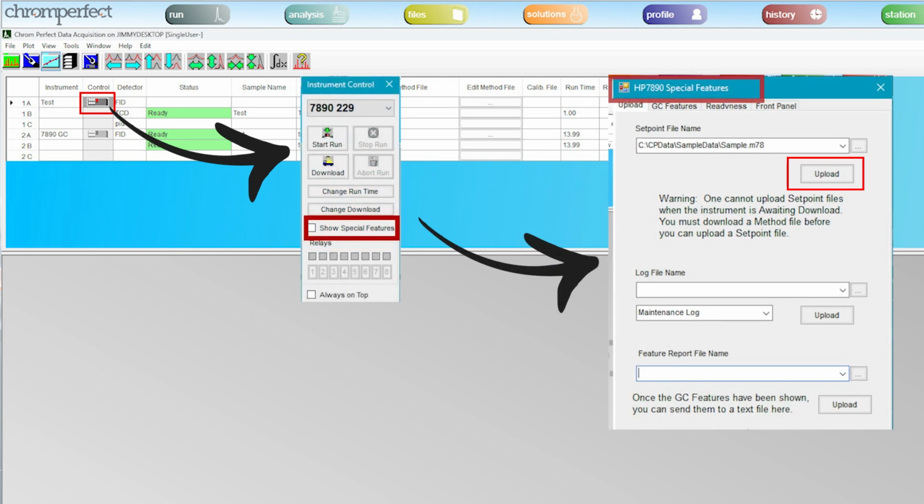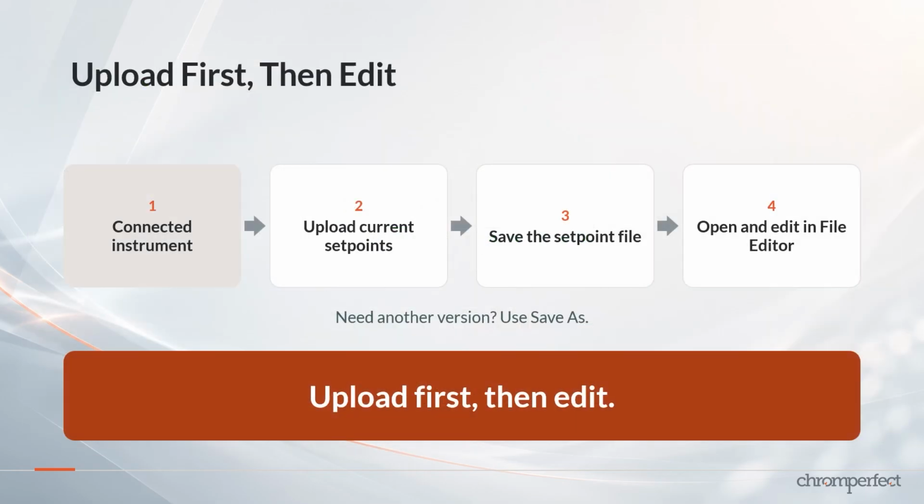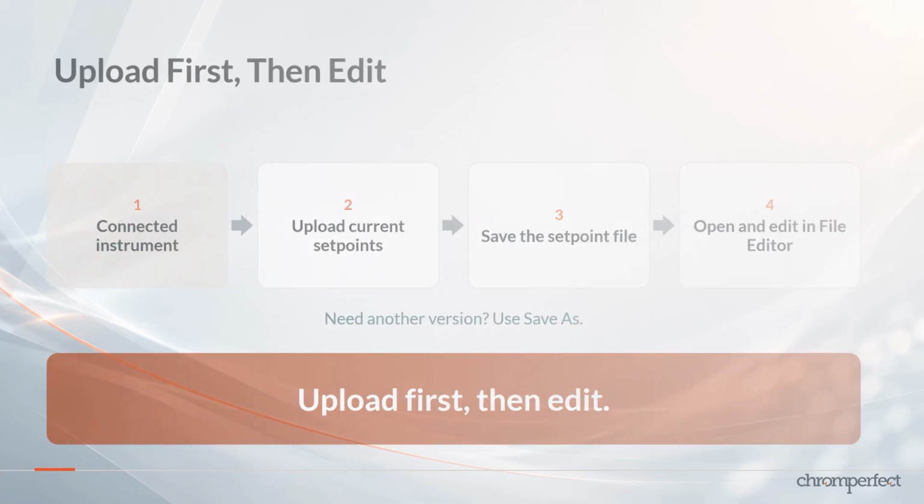Once that uploaded file exists, it can be opened in File Editor. From there, it can be reviewed, modified, and saved. If you need a second version, you can use Save As to create a modified copy. The practical rule is simple. Upload first, then edit. Do not start by trying to create a blank setpoint file in File Editor. Start by uploading the current setpoints from the connected instrument. Then open the uploaded setpoint file in File Editor.